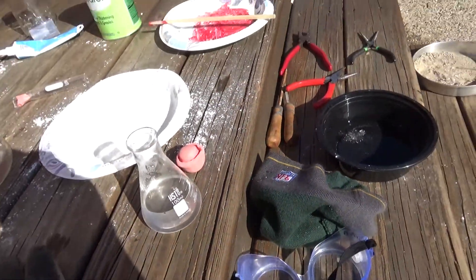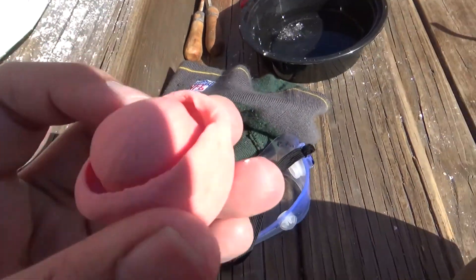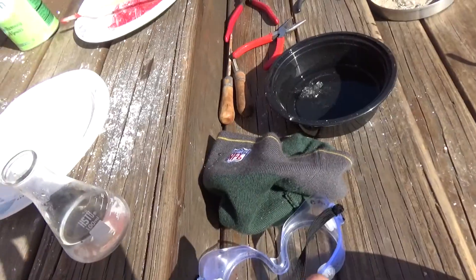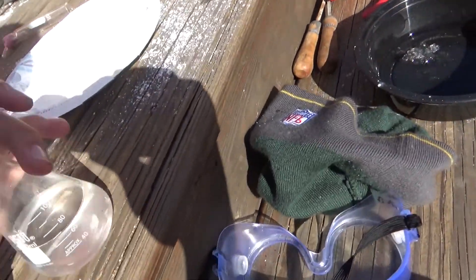Okay, it's been some time. Here is the one I made for the smaller flask. This lip should form a seal — I don't know if it'll be watertight but we're going to find out. I've got some water in there.